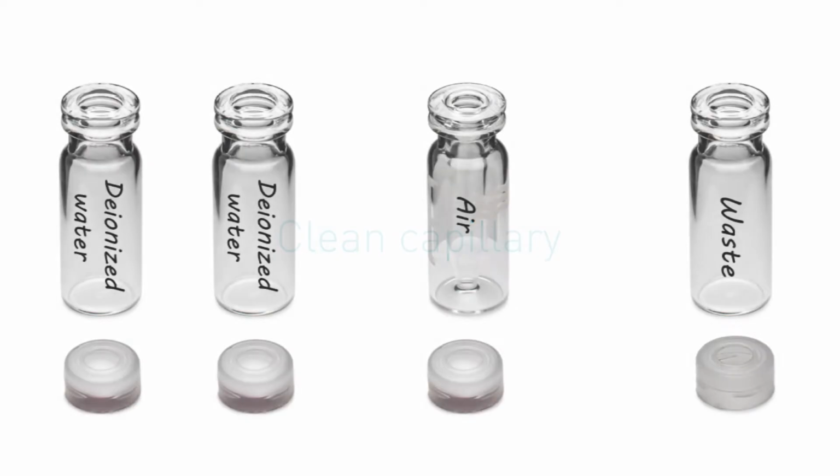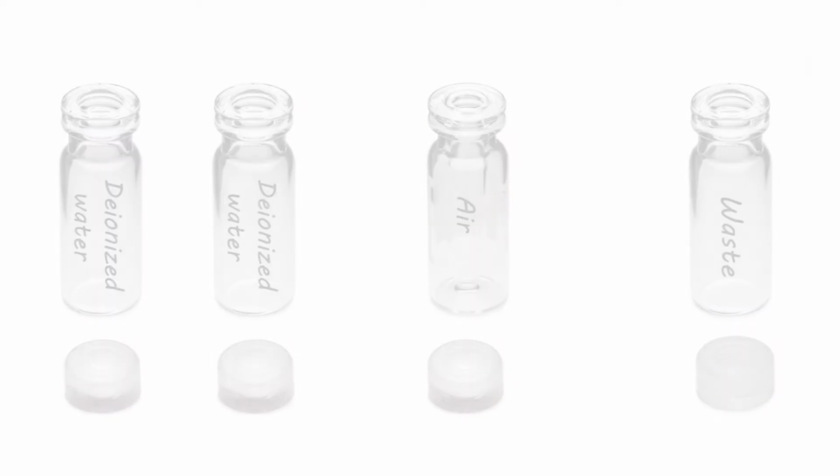Before you begin, make sure you have a clean capillary. Alongside your sample, you will also need 2 large vials filled with deionized water, 1 small vial filled with air and 1 empty waste vial.